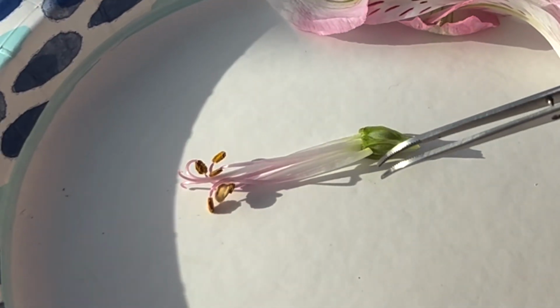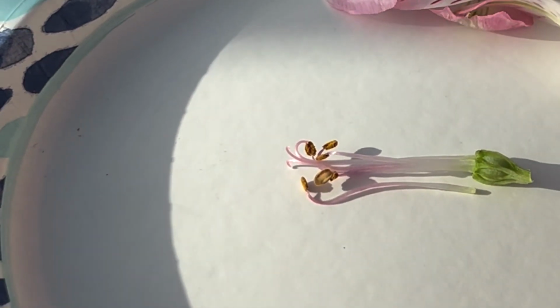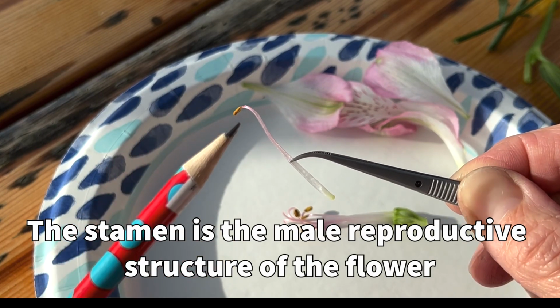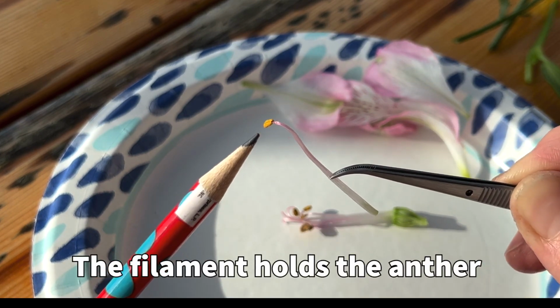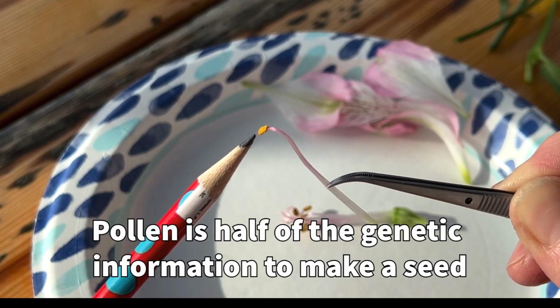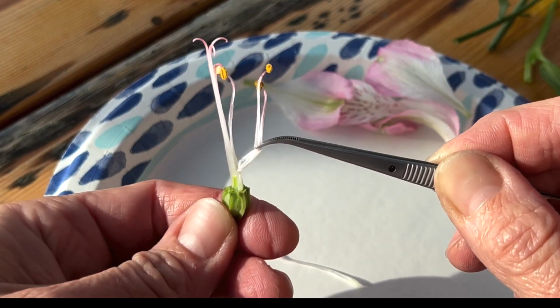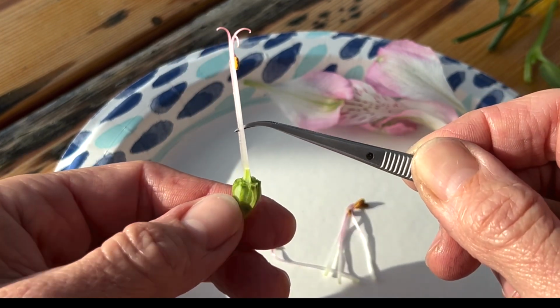So we have the male and the female parts of my flower laid out on this tray right here. The parts that I want to show you first are these. This right here is a stamen. The stamen is the male part and has one long filament right here, and this filament holds up this pollen packet. This has the pollen on it, which is half of the genetic information to be able to make a seed. There are 6 of those: 1, 2, 3, 4, 5, and one more, 6.